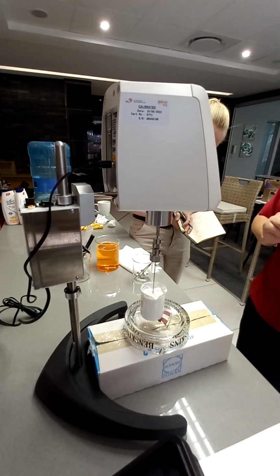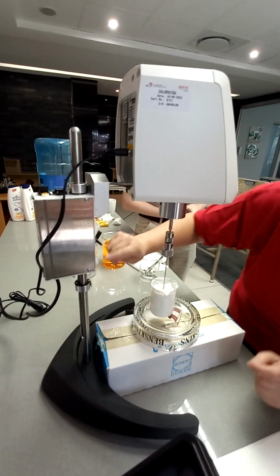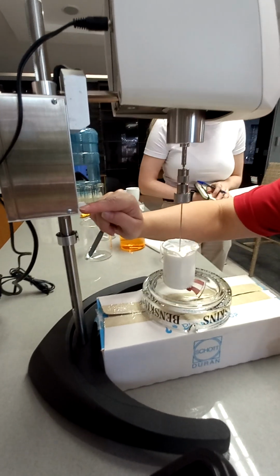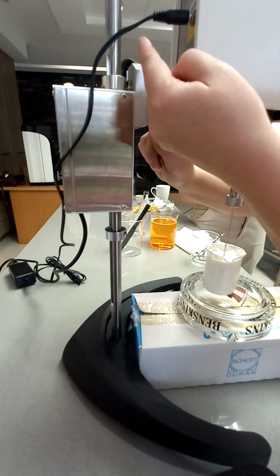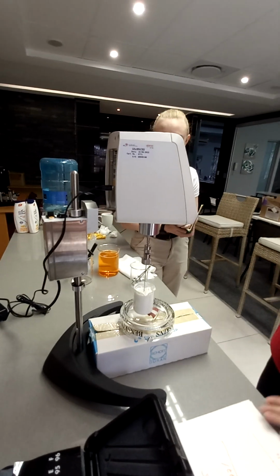Okay, should be good. Then you'll see there's a pin here. Do you see this one is out? You see it? Okay. The motor will go down, it hits the stopper. Once this is in, it goes back up. Then that pin would be out, it hits the stopper, it goes back down, it goes up and down until you stop it.